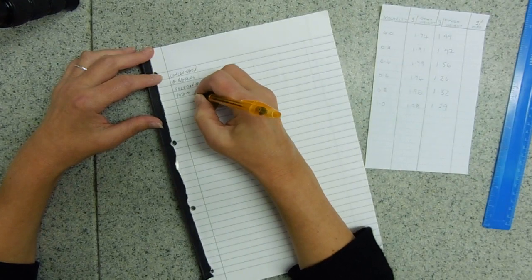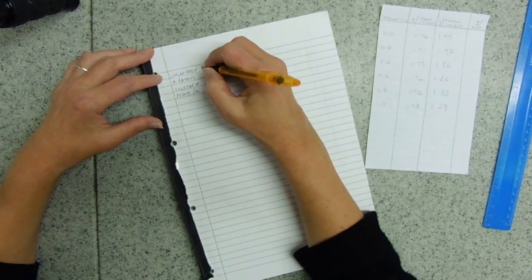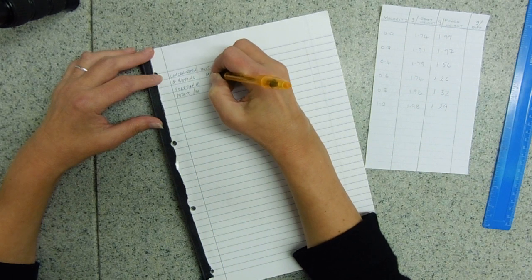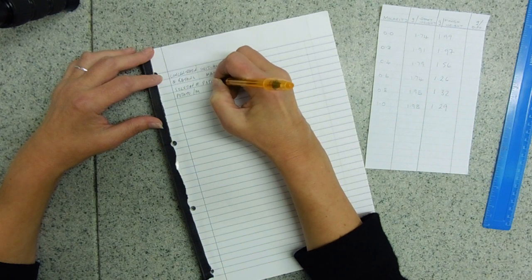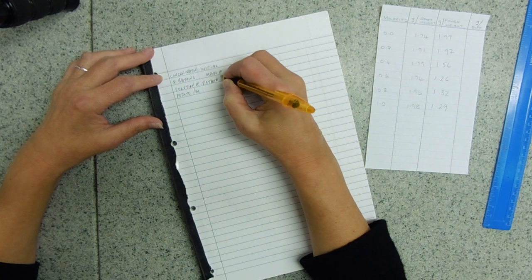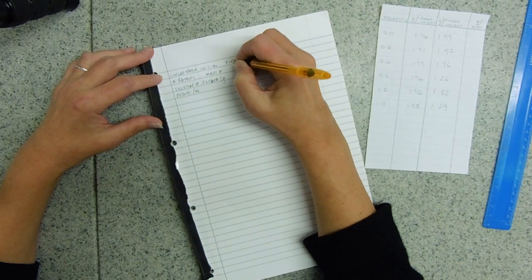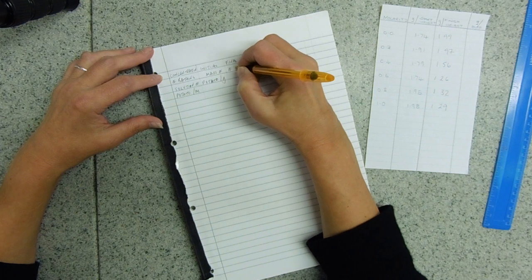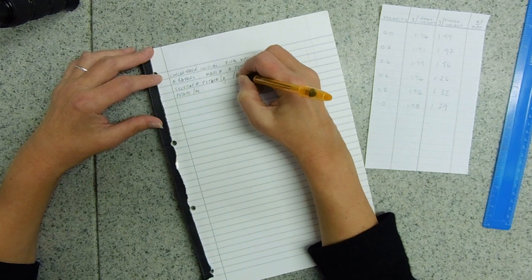I could have put the concentration of sucrose in the bathing solution for the potato, and that is in the units moles. Then I've got my initial mass — and again, it's of a potato. Why not say that? I can't spell it, that's why. And that's in grams. And this is the final mass of the potato in each solution, and again that's in grams.